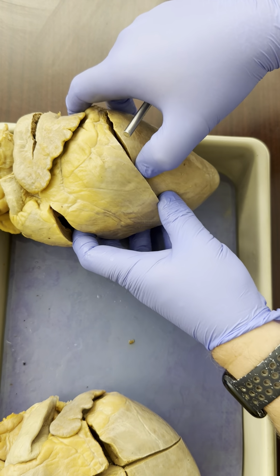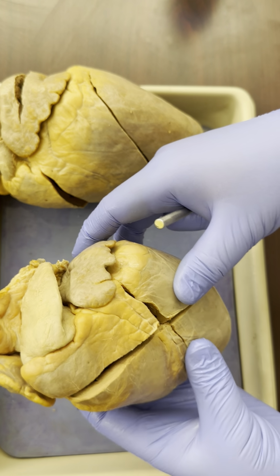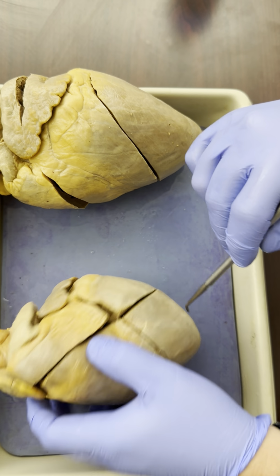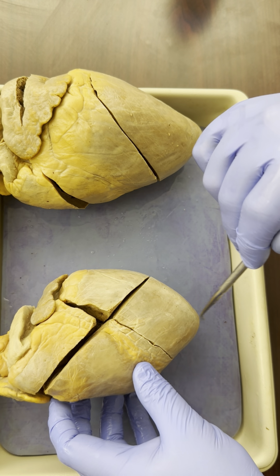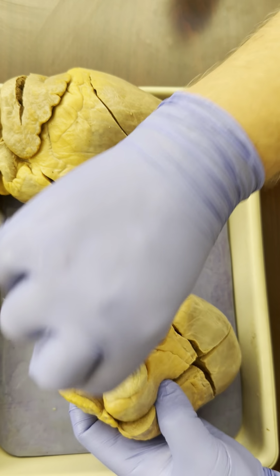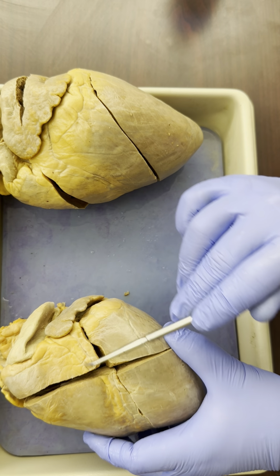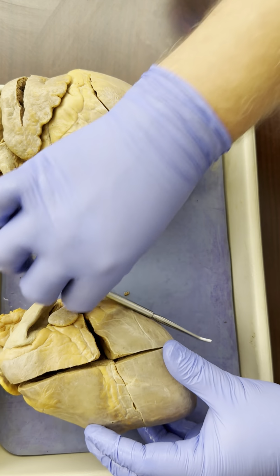But now I'm going to push it to the side and we're going to look at another view of the heart where we can see some other structures a little bit better. Let's orient ourselves. Again, there's the apex pointing down towards the ground. If this were a human's heart, when you stand up, this points down towards the ground. So this is inferior. The vessel's on top, superior. So top of the heart, bottom of the heart. When we look at the heart, there's that coronary artery separating right and left. So over here's right, over here's left.